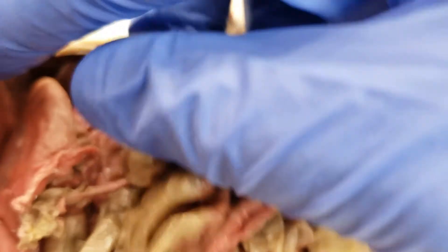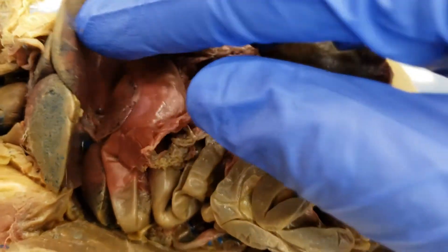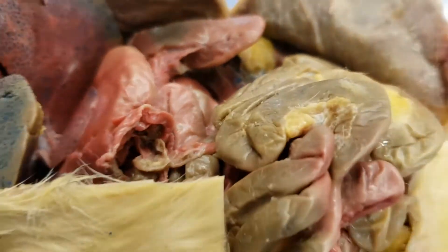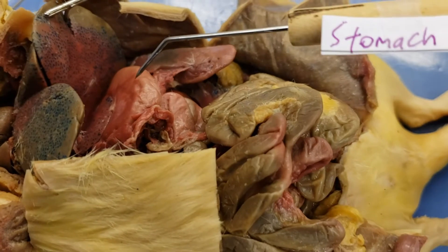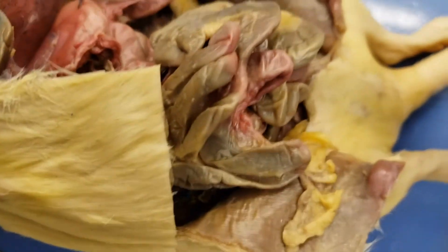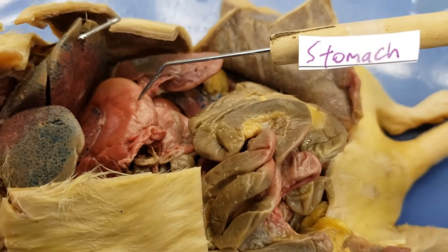Now let's go to the stomach. This bag right here — that's your stomach. If I was feeling adventurous I would cut that open, but not with my phone being so close. The stomach is found right there. It can expand depending on its contents, and with rats they can eat almost anything, so who knows what's even in this thing.